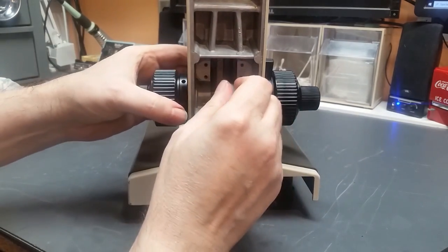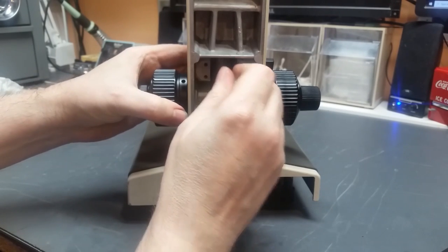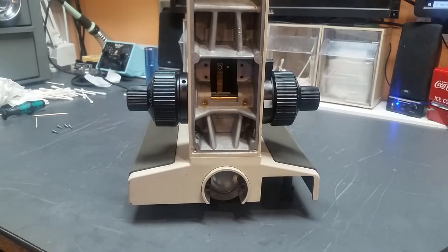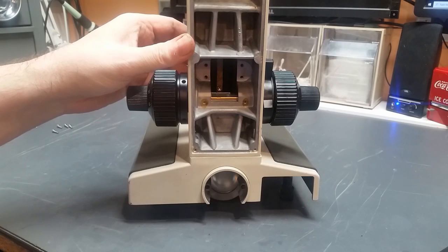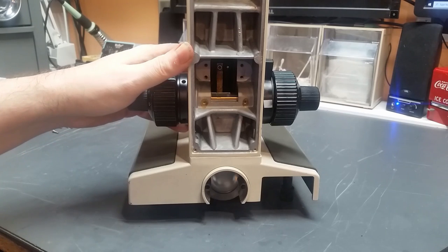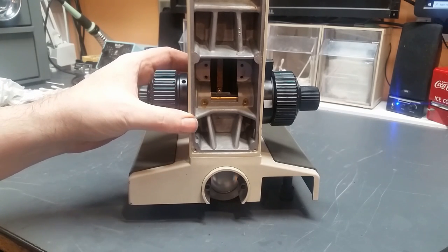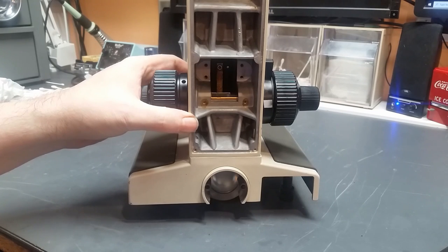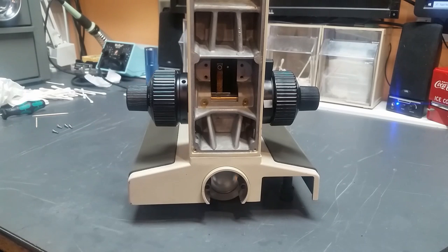Now I'm going to put a little bit of grease over the face of the rack. I know there's a whole religion of people who say don't grease racks. And, well, they're right. And there's a whole religion that says grease the racks, and they're right too. Grease definitely reduces wear on them, and it also allows contaminants to gum up the works. But if you notice, when I took this thing apart, it had grease all over it, so Olympus had definitely greased it, and that's what I'm going to do. If I was building this up for somebody that was going to be using it in a dirty industrial area, then I'd probably not grease it, but in this case, it gets greased.